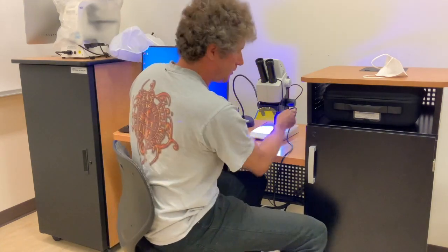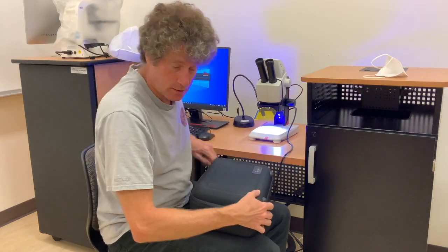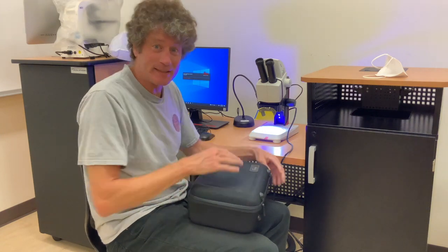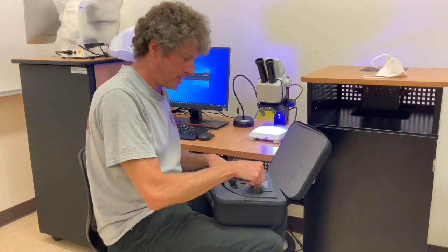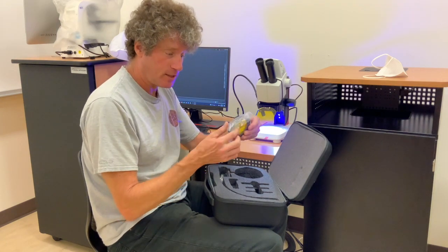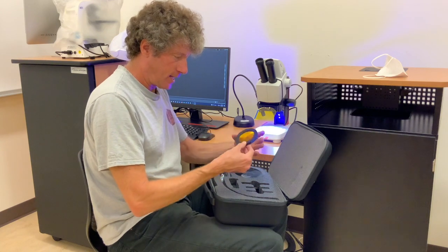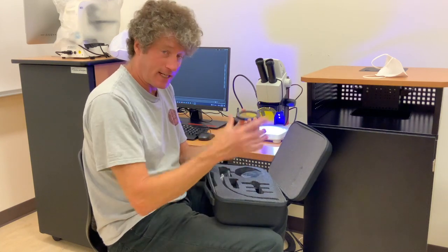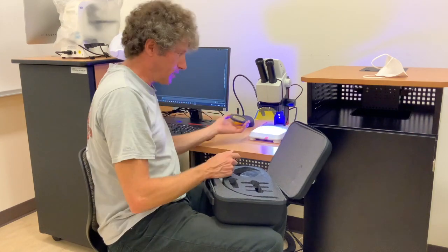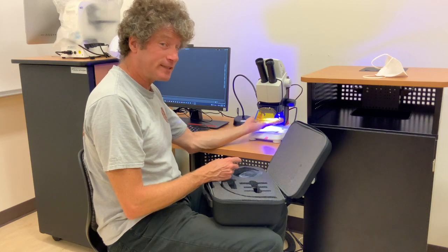In order to use this, you need a filter for fluorescence — it's blue light excitation. There is a band pass filter; be careful with it because it can scratch. It's in this protective cover. You take it out and hold it by the sides. There's a magnet on here and on this adapter, and you go underneath it and it'll click on very satisfyingly.